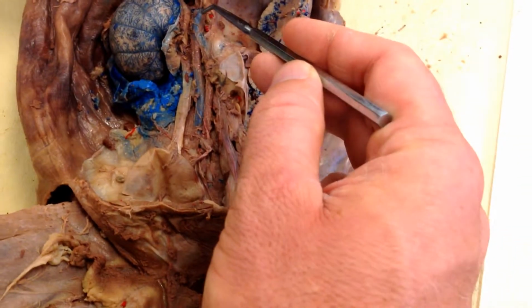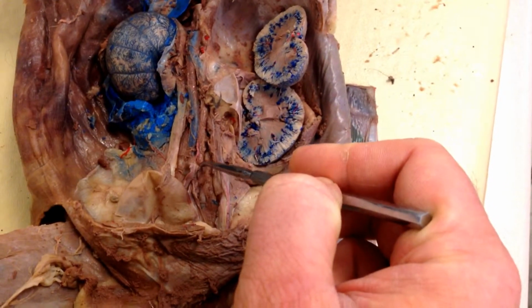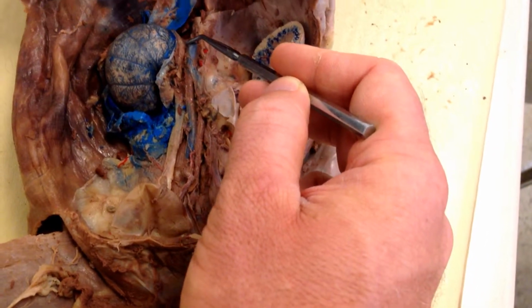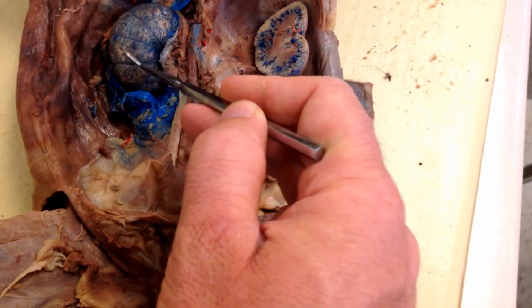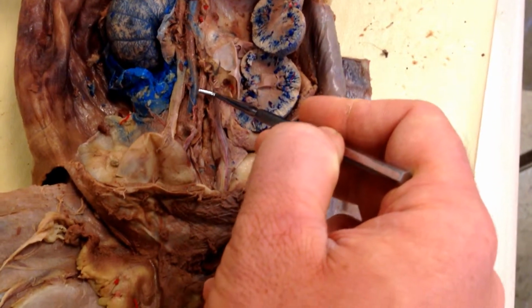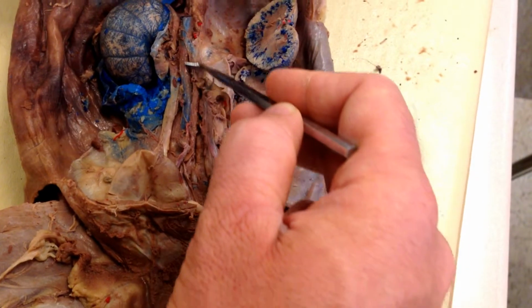45. This is the main vein that collects blood from the lower extremities of the cat and goes up towards the heart, and blood comes out of this organ and pours into it. Number 45 is the name of this main vein here.